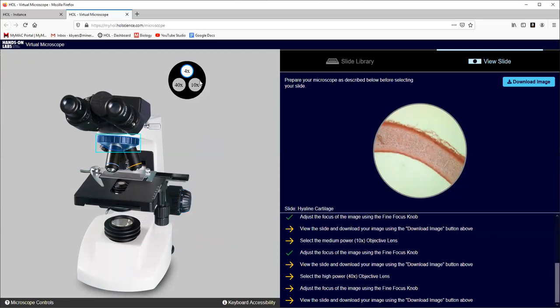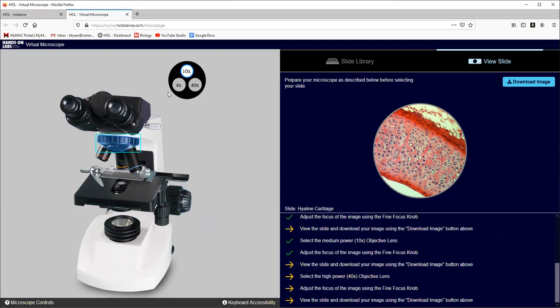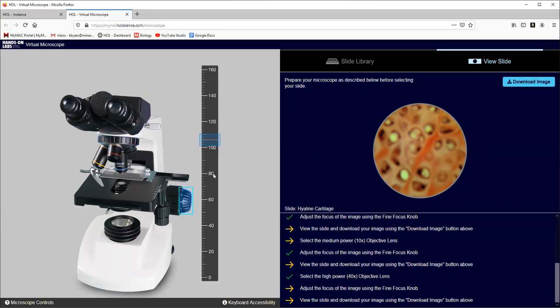And then we can go through and we could change our objective lenses from scanning to low power, adjust the fine focus knob with our keyboard or with our mouse, and then go back and we can change to 40 times the high power, click on that fine adjustment again, and then move just a couple arrows on our keyboard, and now it's perfectly in focus. And so we can see that it looks like cartilage. And so we could just download that, save that file, upload it into our lab. Let me know if there are any questions.